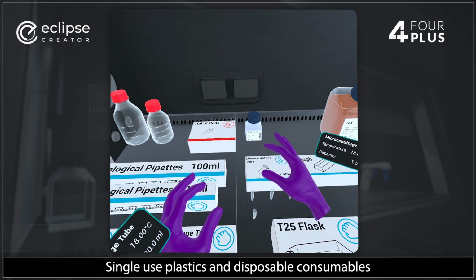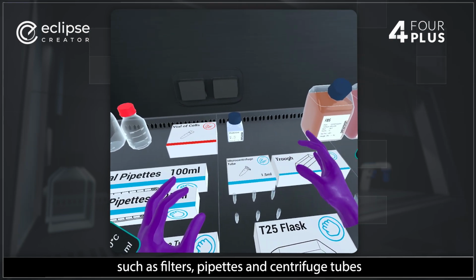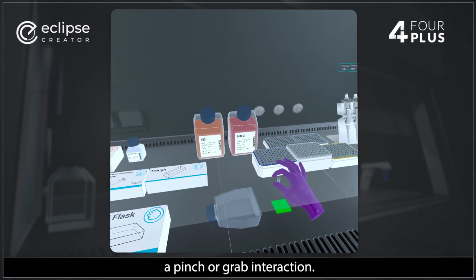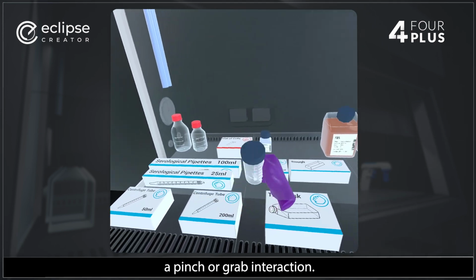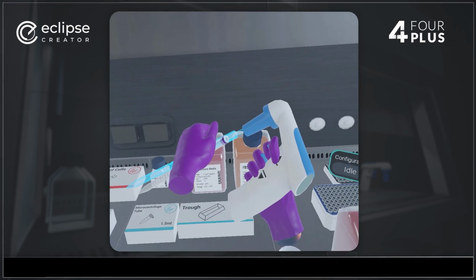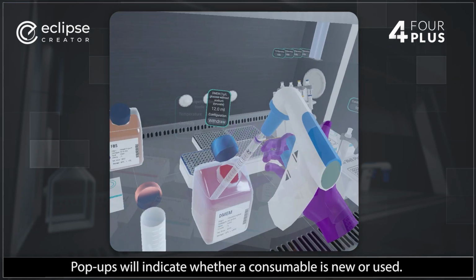Single-use plastics and disposable consumables such as filters, pipettes, and centrifuge tubes can be retrieved from dispenser boxes by using a pinch or grab interaction. Pop-ups will indicate whether a consumable is new or used.